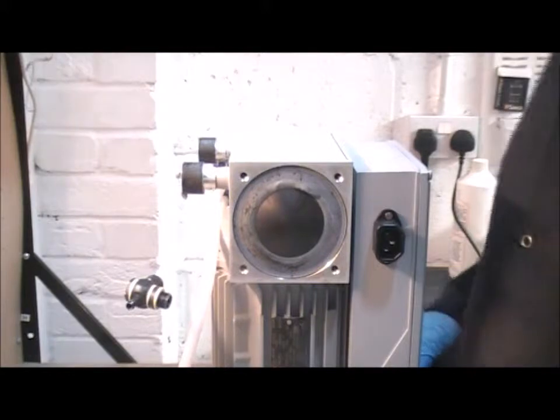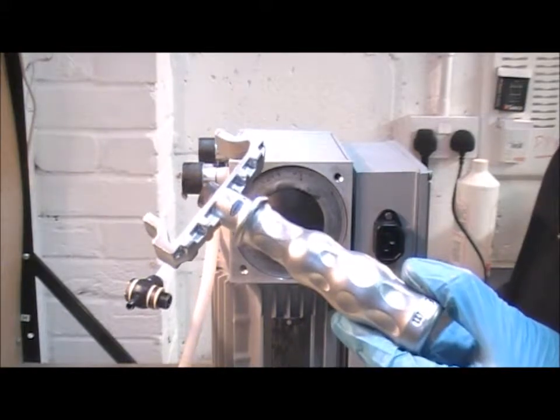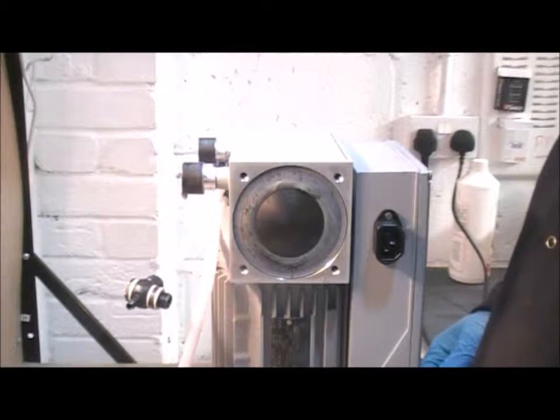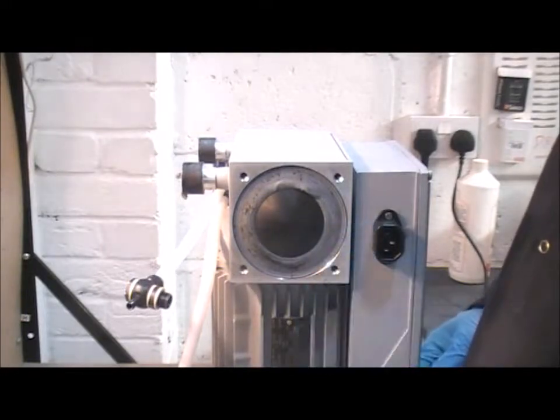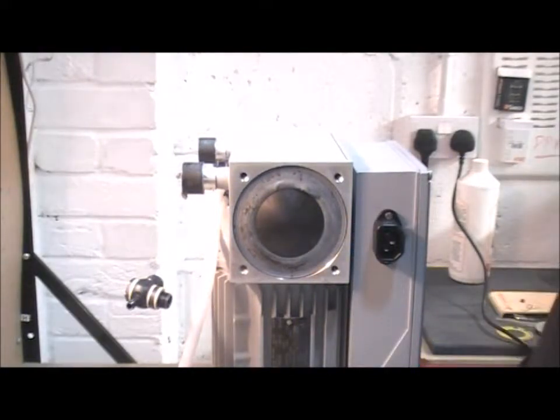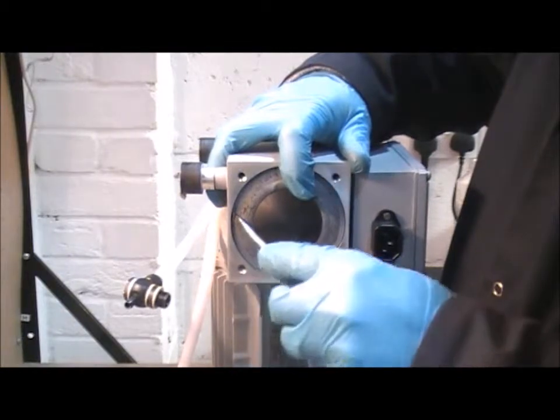So the first thing to do is to take the diaphragm tool that comes from Vacuubrand, and this is used both to remove the old one and to fit the new one. What I need to do next is release the diaphragm from the mounting where it is. And to do this, I'm going to use a flat blade screwdriver. This can be a little bit tricky, just be patient with it.